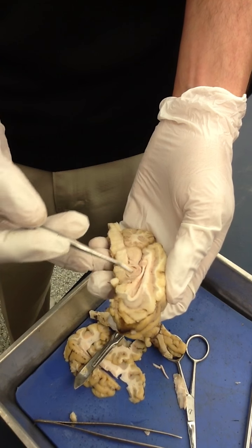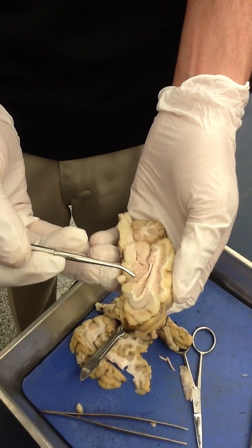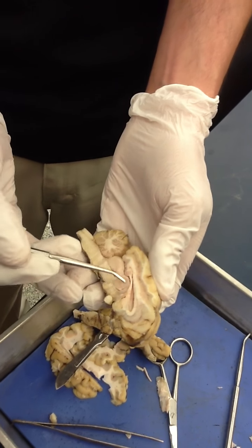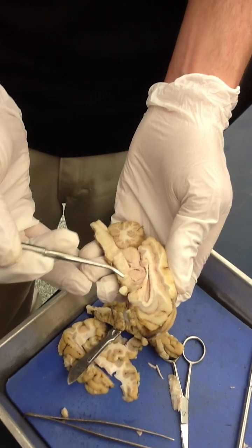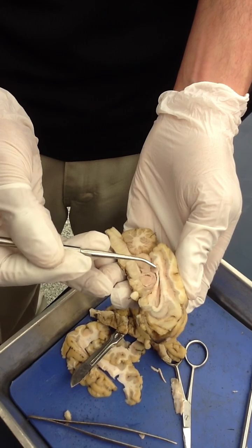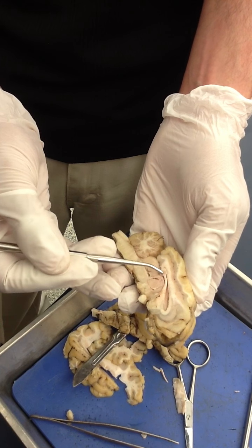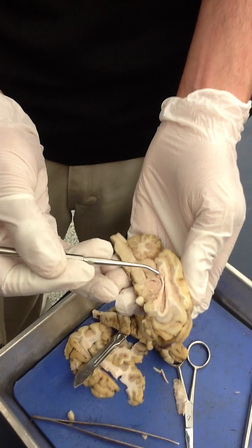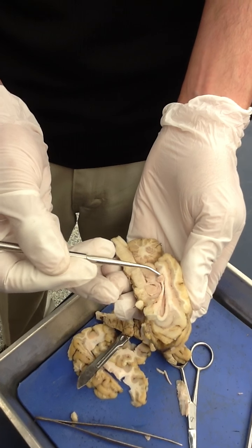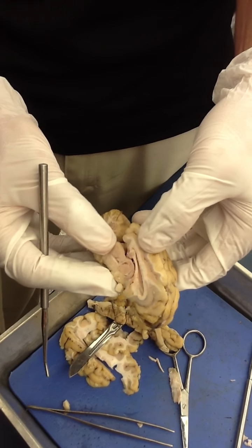Continuing on with structures of the diencephalon: that includes the thalamus, the hypothalamus, and then the epithalamus is this region here, composed of the habenular nucleus and the pineal gland. Bio-160 students need only be concerned with the pineal gland and the other remaining structures of the diencephalon.